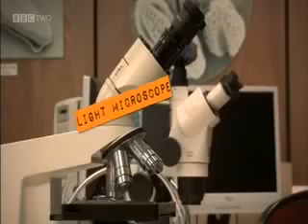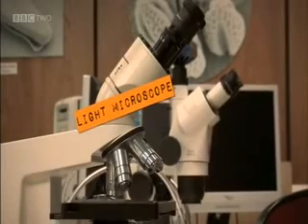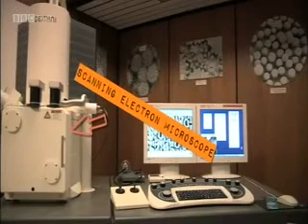There are three types of microscope: light, like this one here, and two types of electron microscope, like those ones over there.